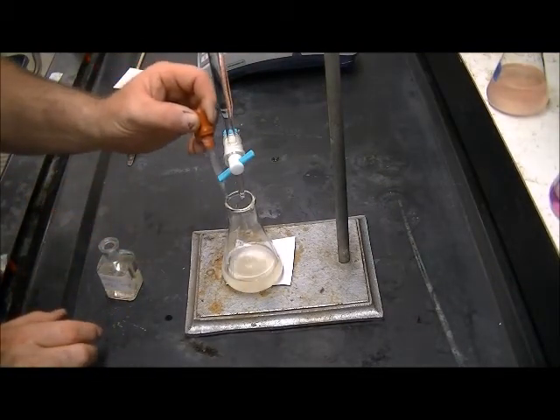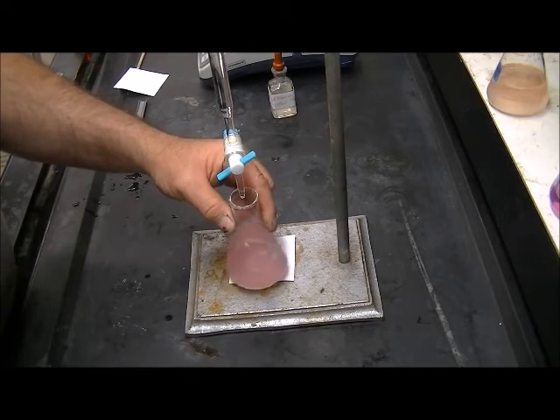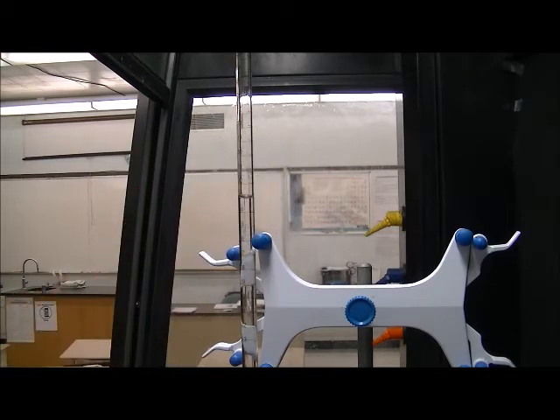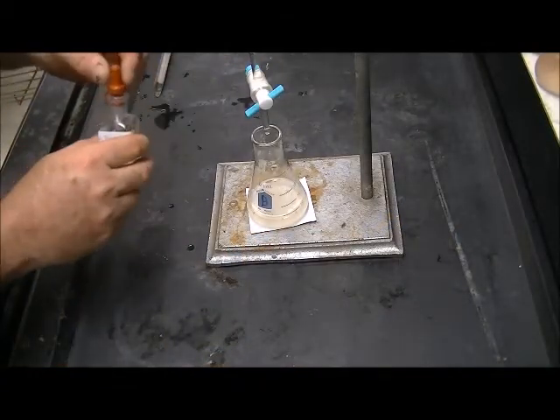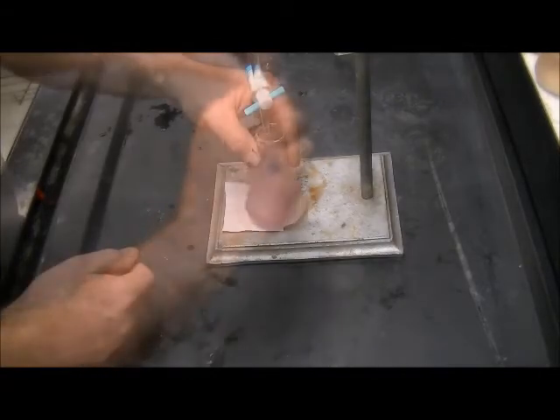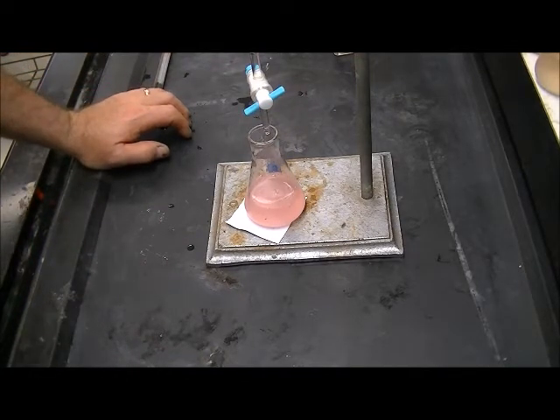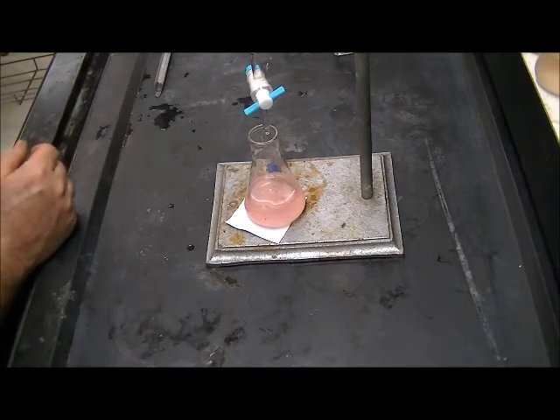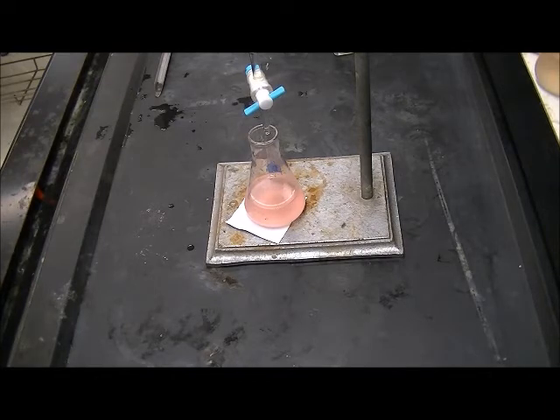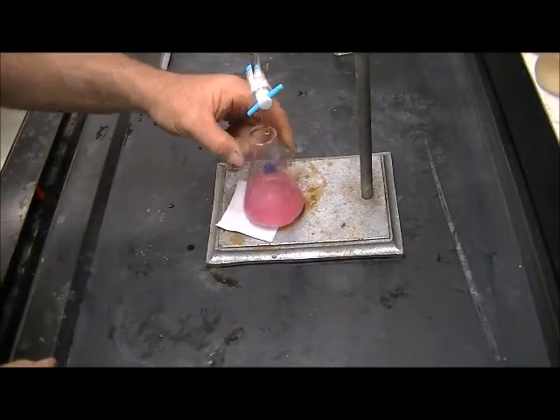For the second tablet, the endpoint volume is 33.0 milliliters. For the third tablet, the endpoint is at 32.4 milliliters. I ran a little more in just to confirm the color does get darker — yes it does — so I did find the correct endpoint.